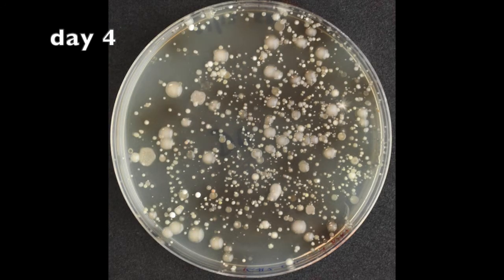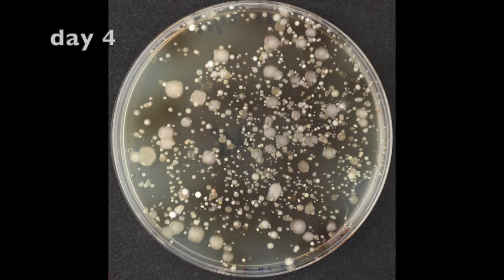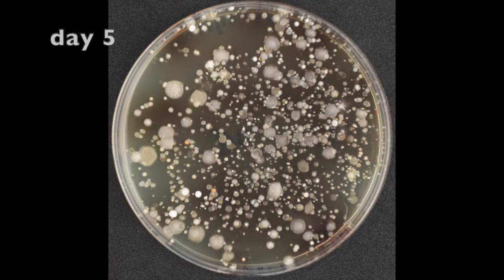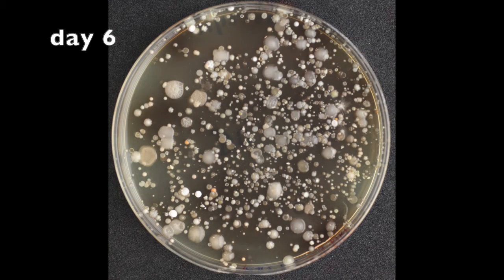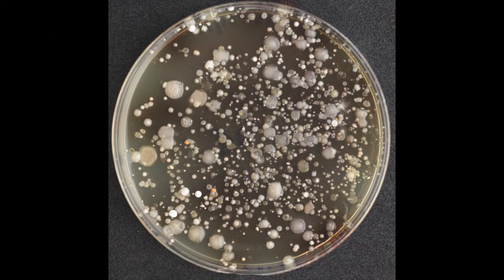After six days we select nine streptomyces colonies for further characterization. For your lab report you can concentrate on just four of these colonies: A, B, C, and D.